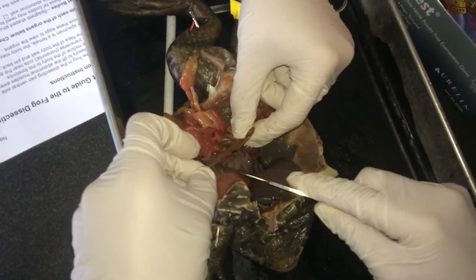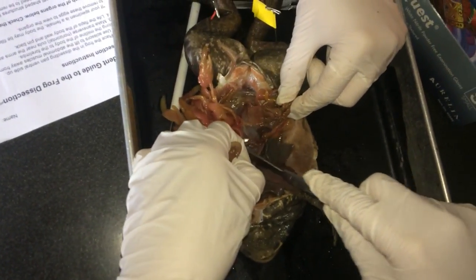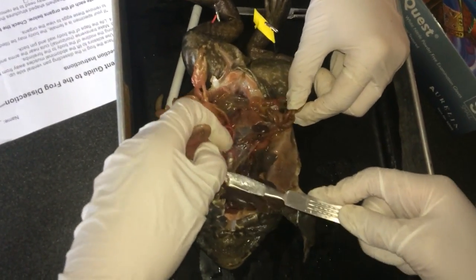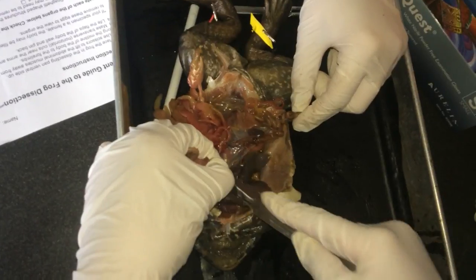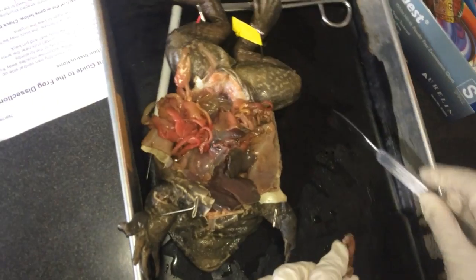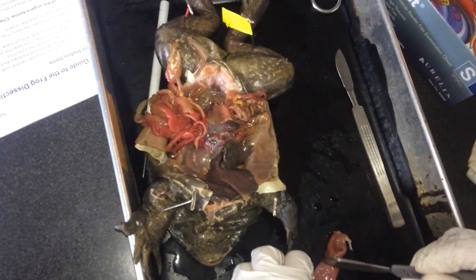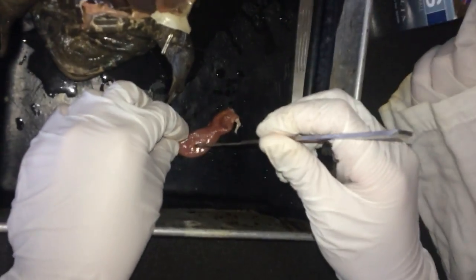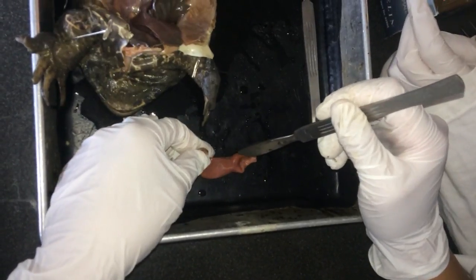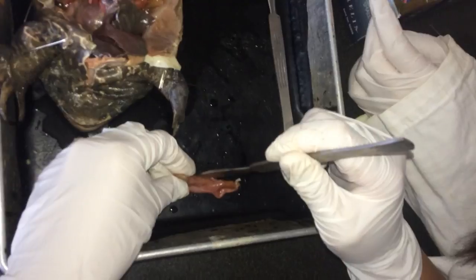It would be better if it was fresh, but it's not. Been here two weeks. This is the worst scalpel ever. This one over here is better. I would not be able to do that. Cut it open like this or like this? Maybe the video said cut along the side there? Curvature — the greater or the lesser. Which one was it? Does it matter? I think this is the greater. Is this this side, right? Mm-hmm.